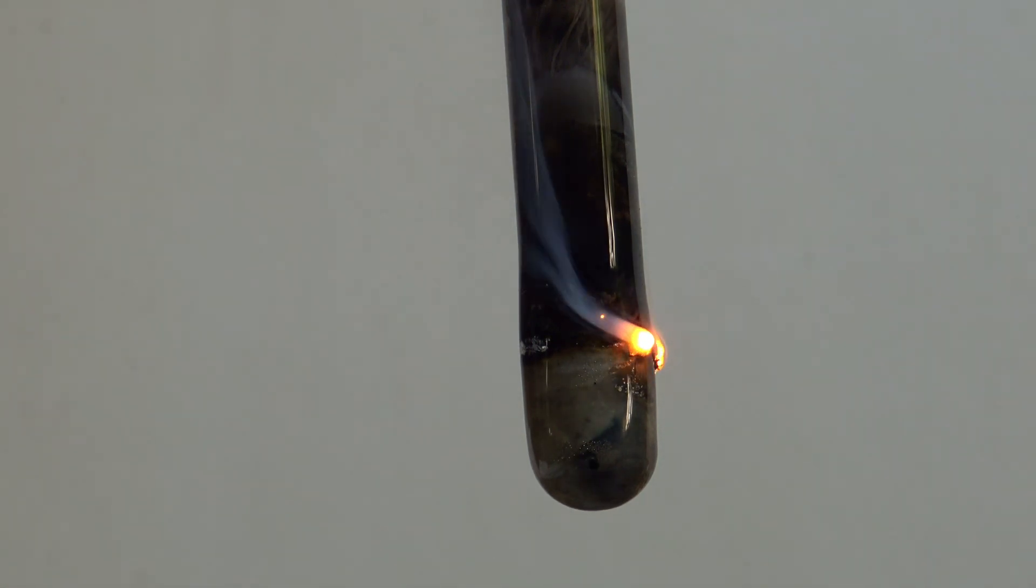The sodium and maybe traces of cesium burn in the air, while the sodium also possibly reacts with the glass to form silicon.